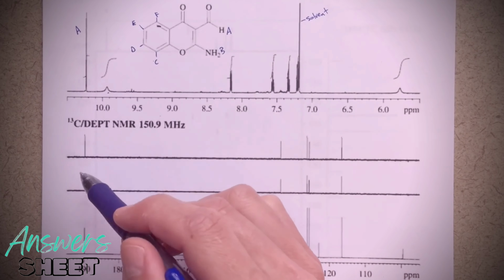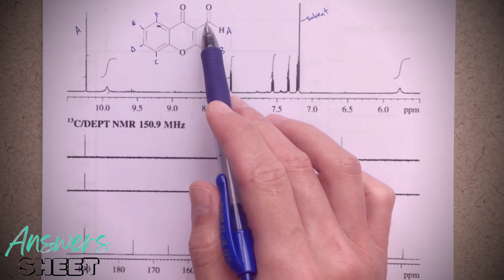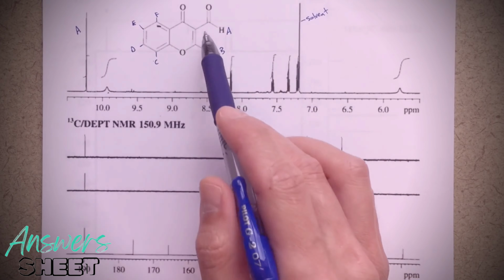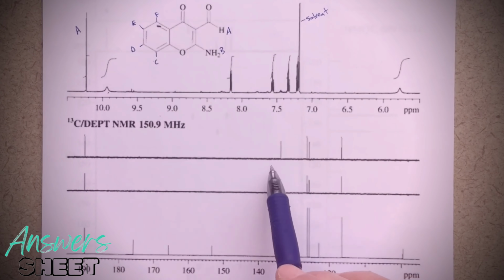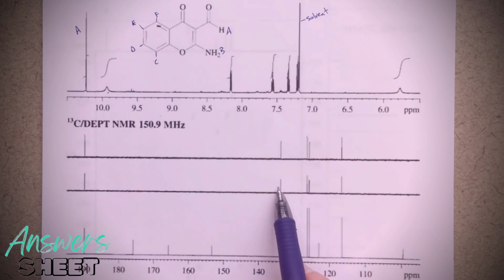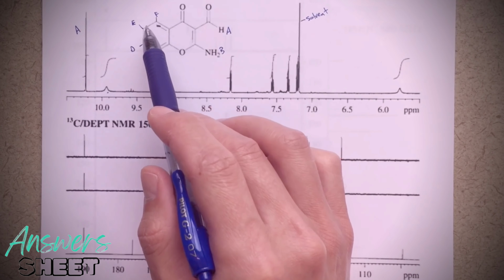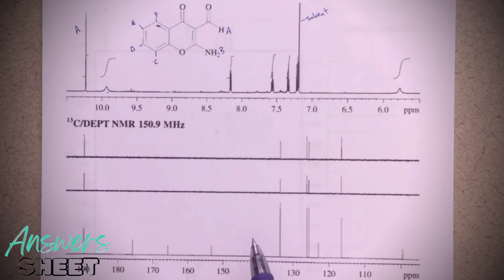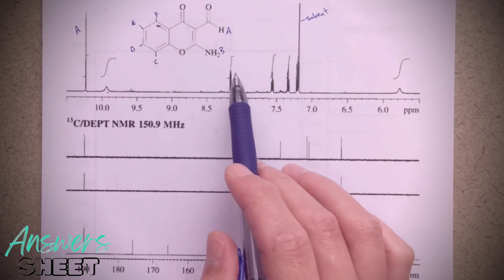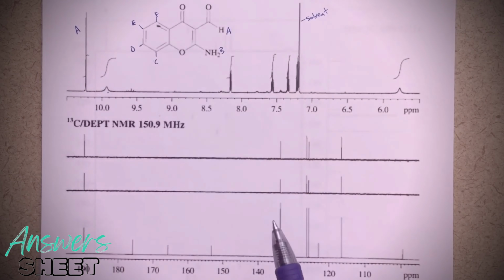Simply because that's where the carbon for an aldehyde is going to be. So this carbon here, I can tell is this signal, and this DEPT is telling me that these carbons, 1, 2, 3, 4, 5, are the carbons that have protons attached to them. So then these 4 signals here must be the carbons in my aromatic ring bonded to F, E, D, and C. That's what this is telling us. But eventually, we're going to be able to assign all of these signals to the different carbons and protons in my structure.